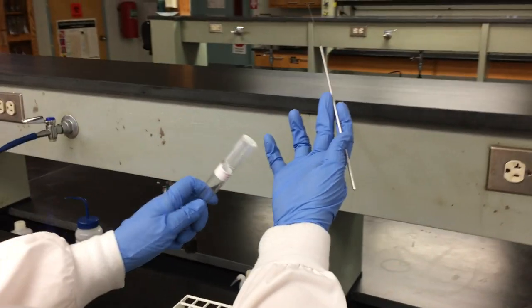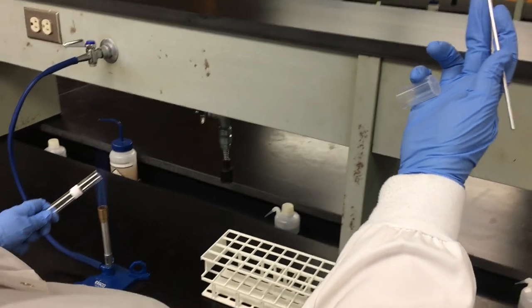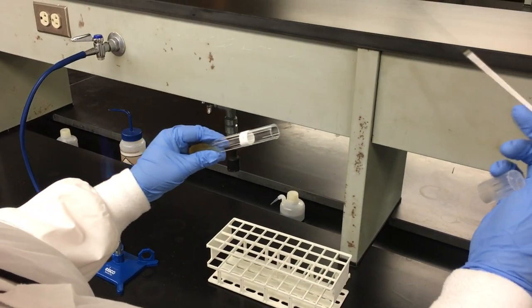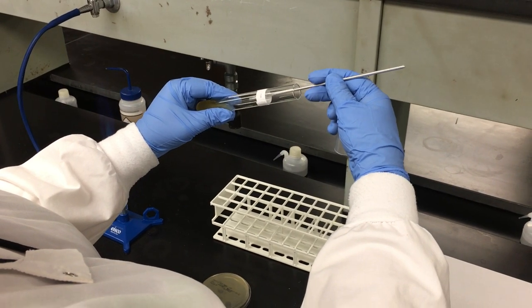I will then remove the cap using my pinky, using aseptic technique. Run my tube through the flame. Go in, agitating the broth to make sure I get enough mixture of organism.